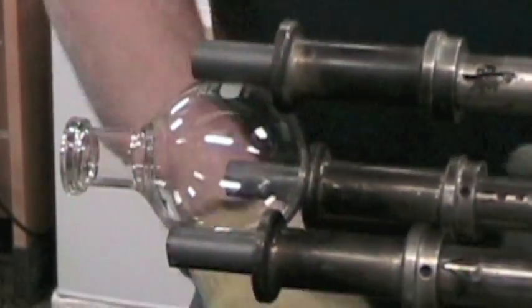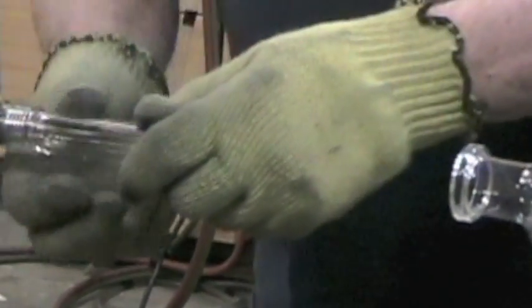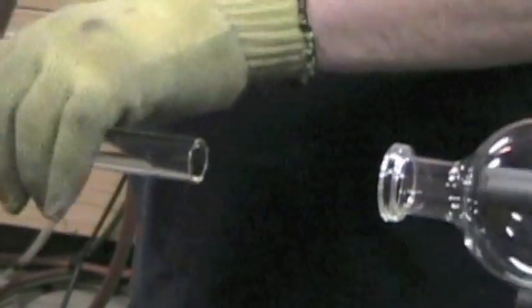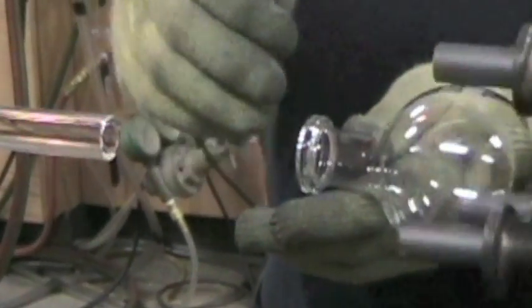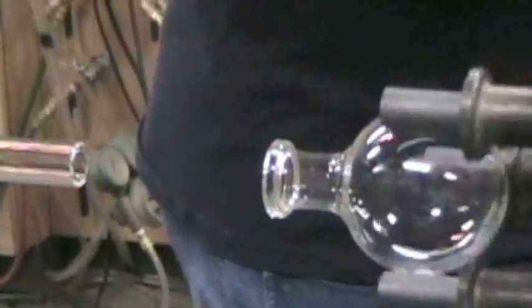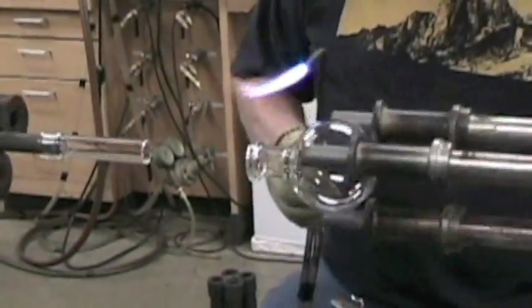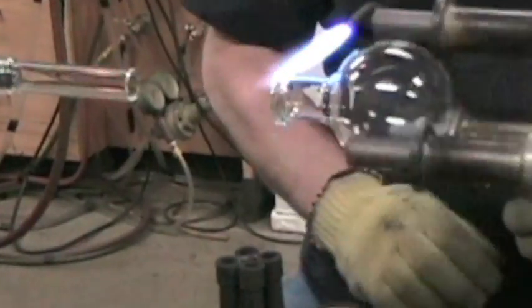This needs to go out the end, so to apply it, I've built a special holder out of graphite with threads that screw into the mechanism. So I've got to take this part off to apply that. So while I'm taking it off, I'll shape it down to a better size to connect everything with.